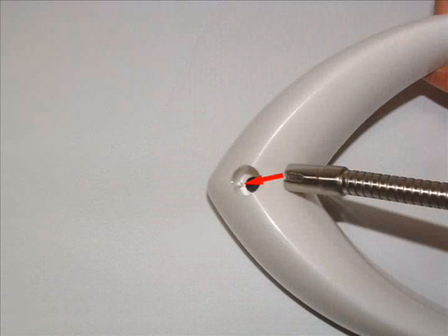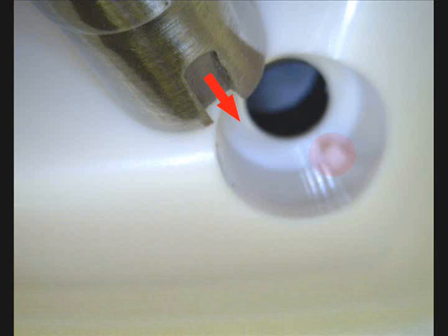Connect those to properly attach the rod to the base. Here is a closer view of the connecting points highlighted in red. The groove on the rod should latch onto the area highlighted in red.